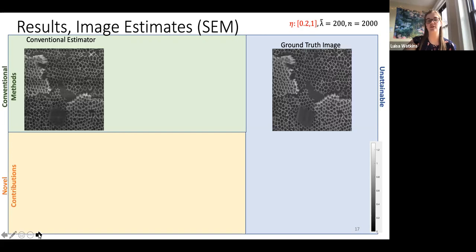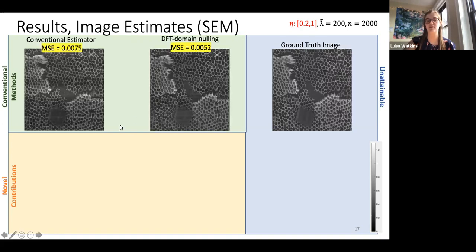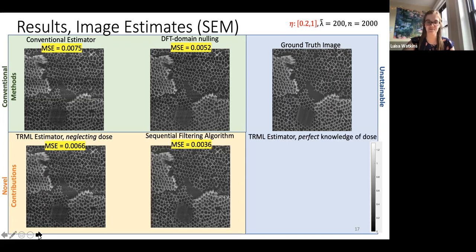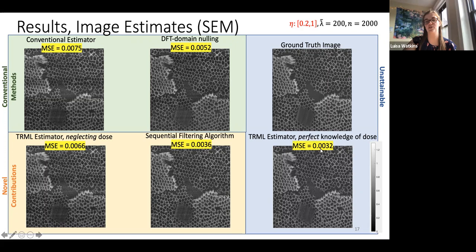So we have a different ground truth where we have still a conventional estimator, the DFT, which tries to clean up the stripes, the robustness of the TRML that doesn't think of the dose, then my algorithm that actually tries to estimate it, and then the perfect if the TRML estimator knew it perfectly. And if you notice, the stripes are very hard to see because SEM is a very difficult problem and they're so similar, where again, if we look at the relative MSEs here, they're so small, and there's hardly a difference. But if you notice, my algorithm is very, very close to knowing perfectly what the dose is, which just shows how great of a job that the algorithm can do.